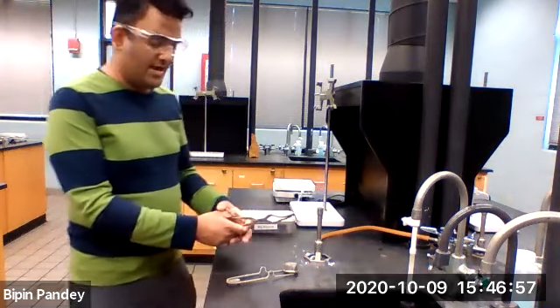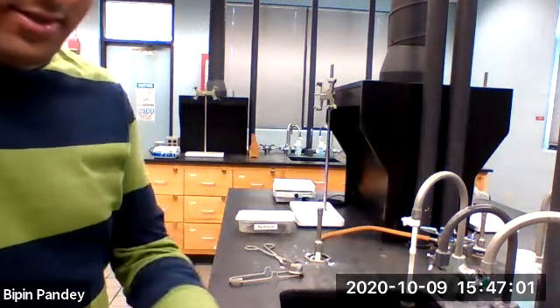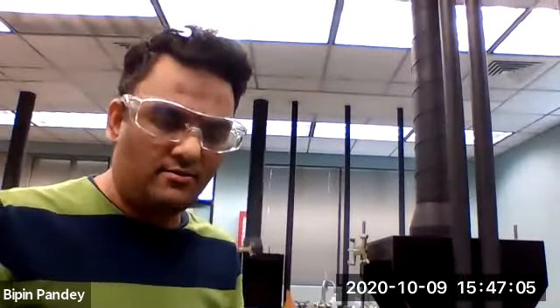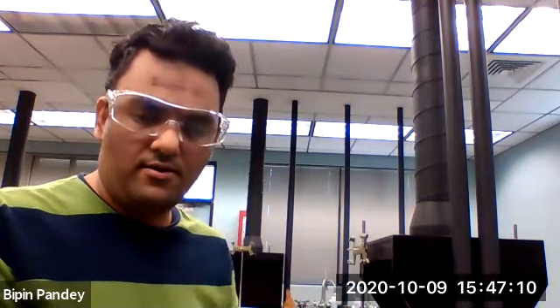So that's it for this lab. Now report the observations and think about the chemical reactions and the balanced chemical equations, and complete the lab.